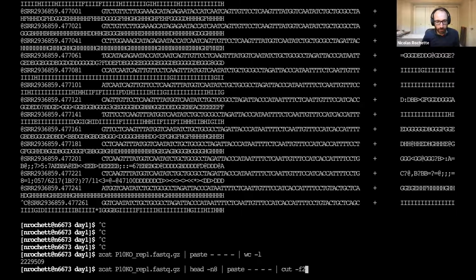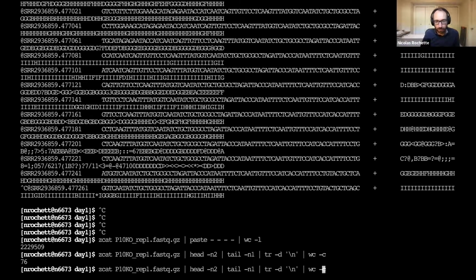If we go back to that one. This was the command we used to count the number of bases in the first read, right? When we have these commands with pipes like this, it's really a series of pipes, and I think that's where the word pipelines comes from. But maybe not. Maybe they just reused the pipe because the word pipeline already existed.